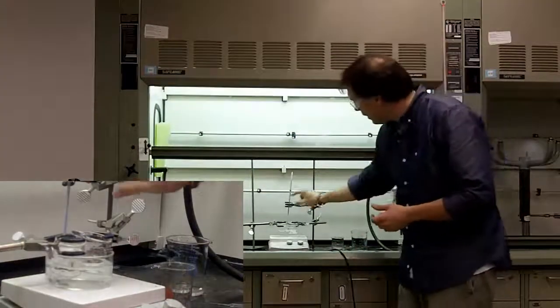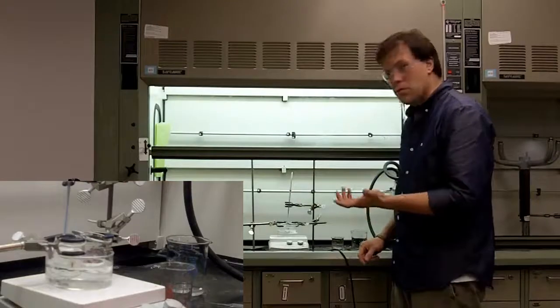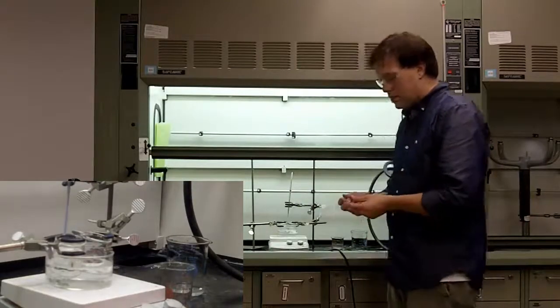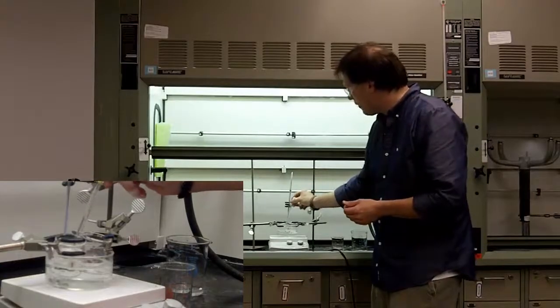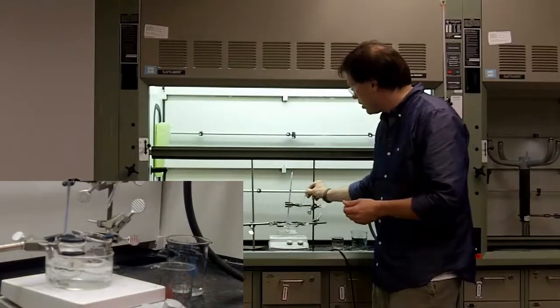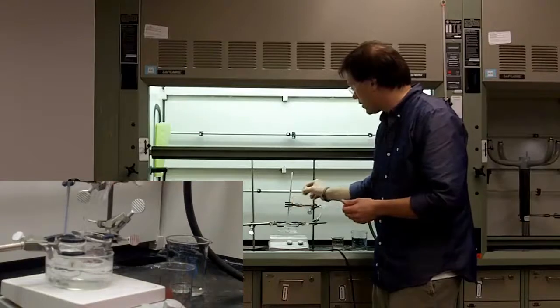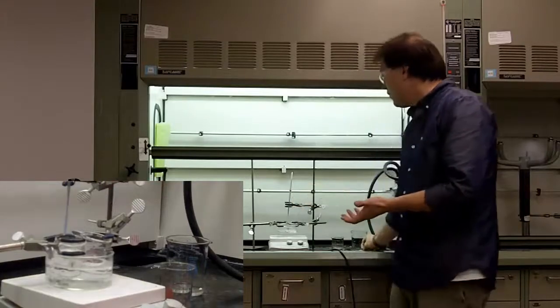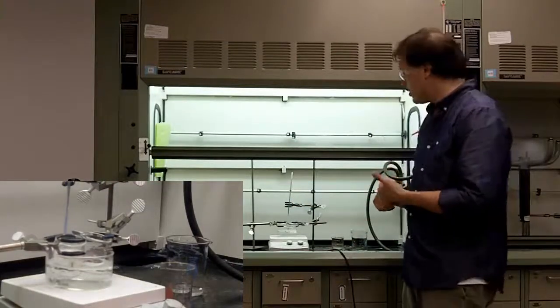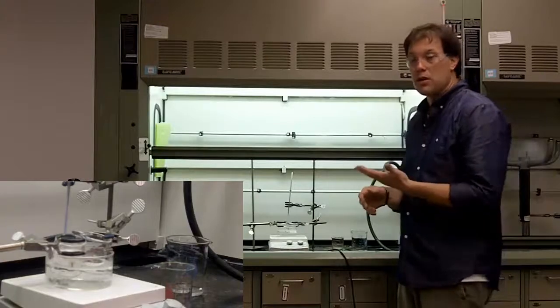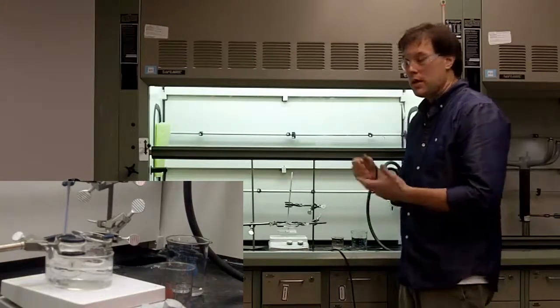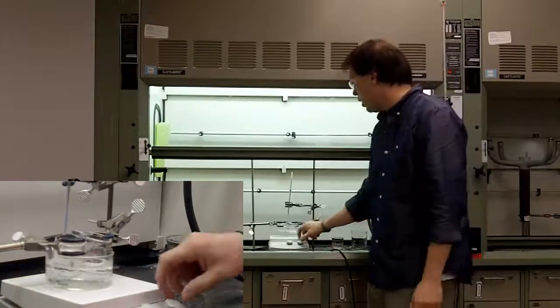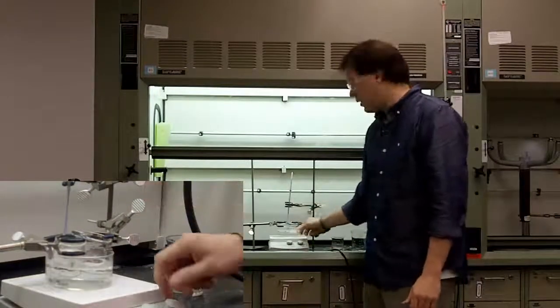Now, by maintaining the temperature in the water bath using the thermometer, instead of taking water from the outside and moving it into your crystals to dissolve it, you would just pull it from your solvent's beaker and transfer it over. So, very quickly, with the recrystallization dish, thermometer, and a couple of beakers, you can set up your recrystallization where you actually control your temperature, instead of worrying about your temperature shooting all over the place by putting it directly on.